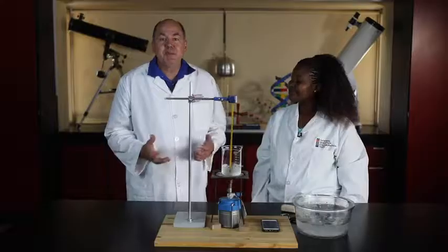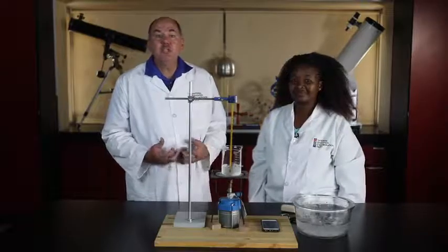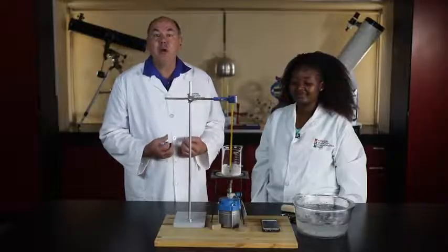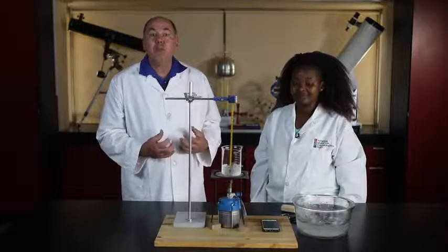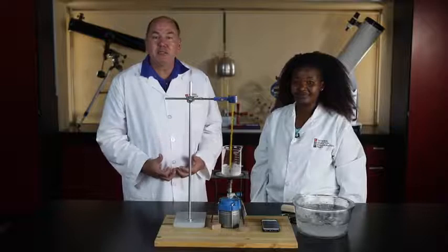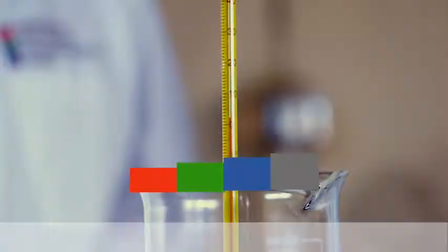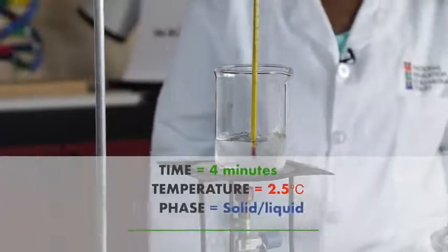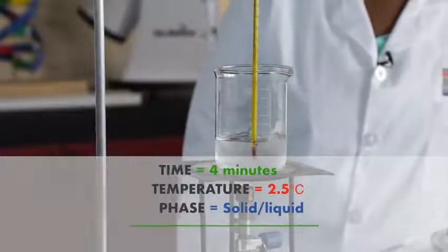Now we're going to speed up the video and just show you the temperature readings each time. If it goes too fast, you can always rewind the video, or you can pause between each of the set of readings. Are you guys ready? At 4 minutes, the temperature is 2.5 degrees Celsius. The water is still solid/liquid.